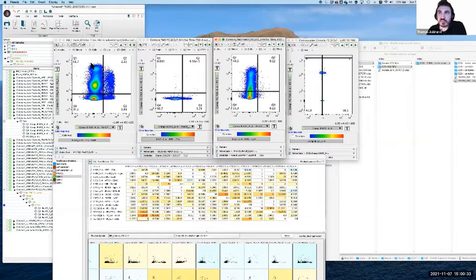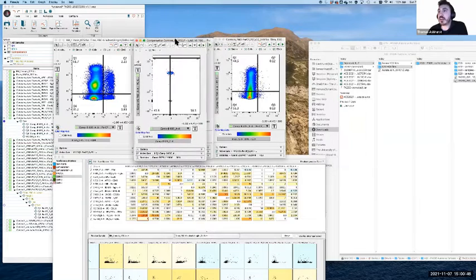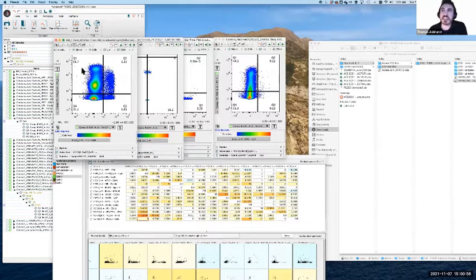So that's really just preventing, I suppose, subtracting some overcompensation that was a little bit too eager. Now, if I was to hazard a guess as to why this might have happened, in this case, the single stain and everything seems to be performing fine. What I suspect is that this single stain control is not quite as bright as the cells that are actually in my sample. And so what I've probably done is not given it signal that's bright enough to accurately compensate it.